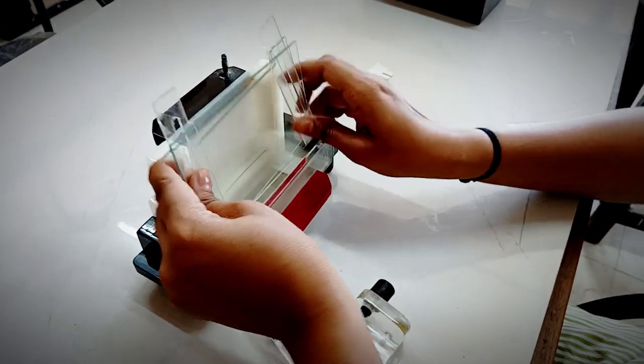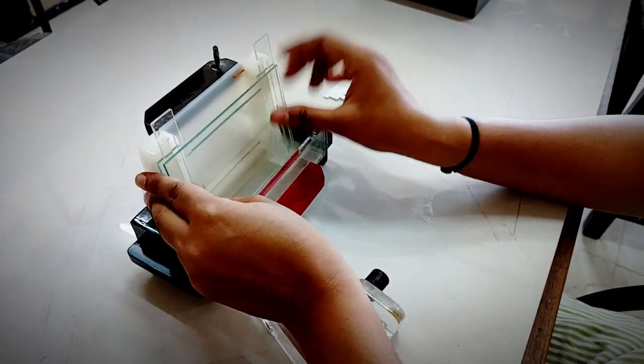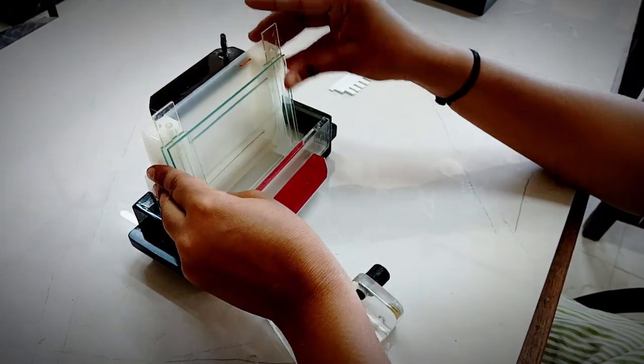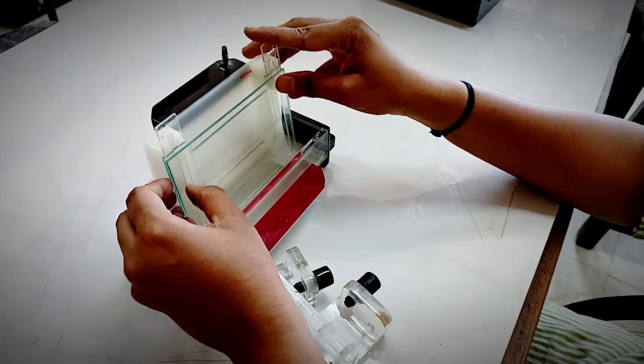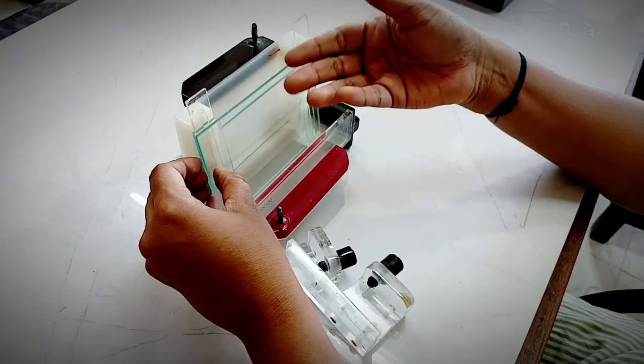In this manner, you are supposed to place this. So the glass plate which has the notch should be inwards.